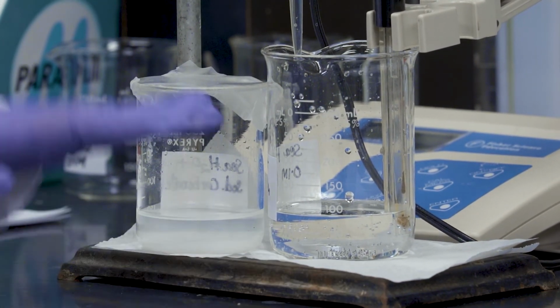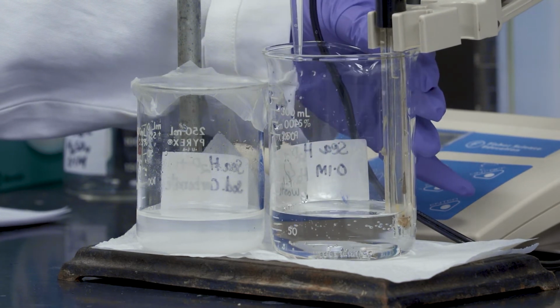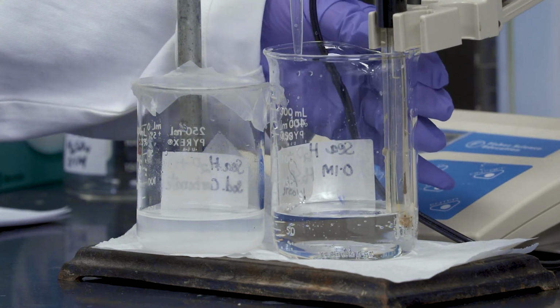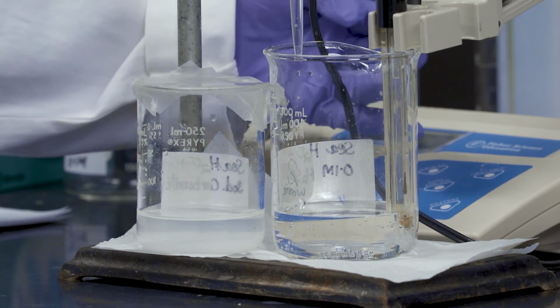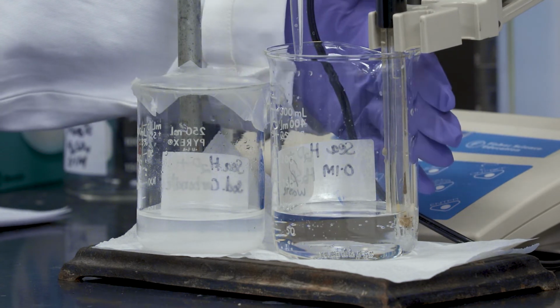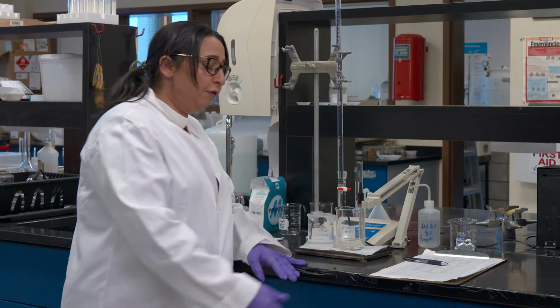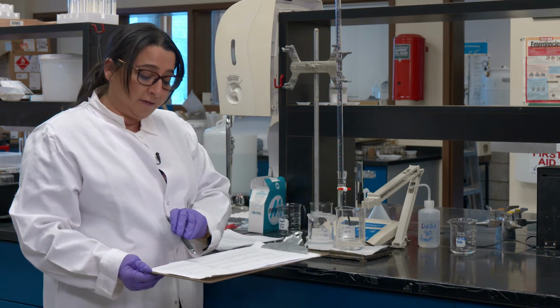now. And if we can zoom in, you will see the solution start having some bubbles, which means we are moving from bicarbonate towards the CO2, and the CO2 is the one that is a gas, and that has a bubble in an aqueous solution. But I still have to move further. Remember, I said we will be going until we hit the pH 3, so I haven't hit it yet.